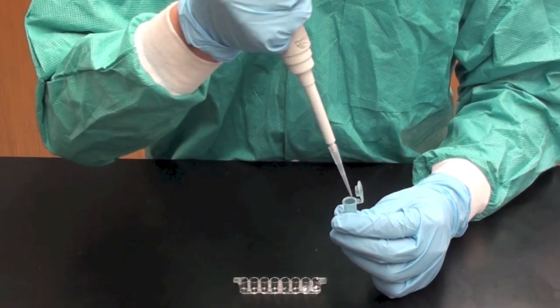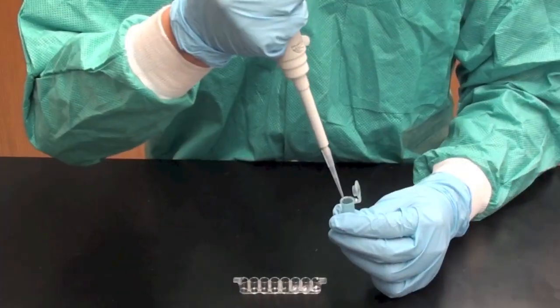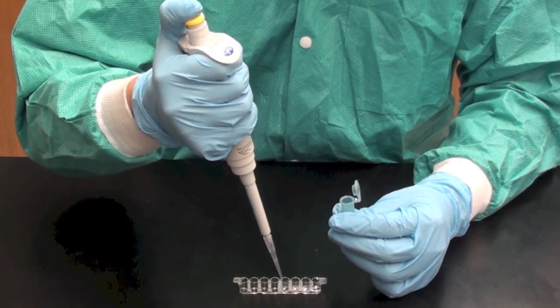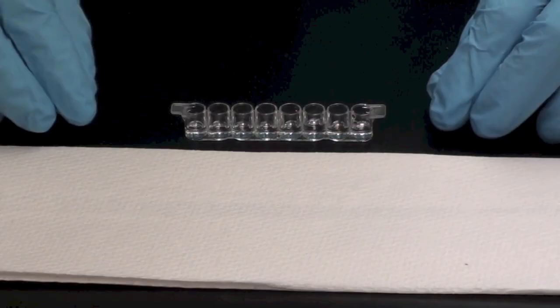Pair up with another student and repeat, transferring 50 microliters to the third well after your second partner, and 50 microliters to the fourth well after your third partner. Share the 8-well strip with your lab partner. Each of you will only use 4 wells. Incubate your protein antigens at room temperature for 5 minutes to allow the protein samples to bind to the well.